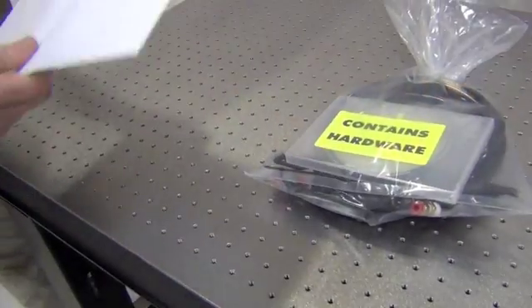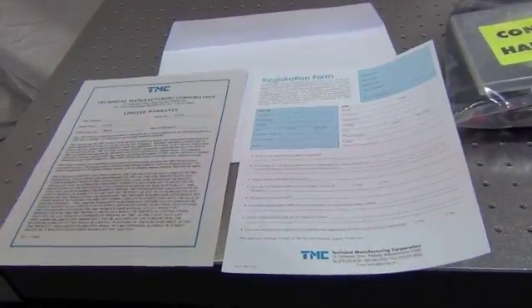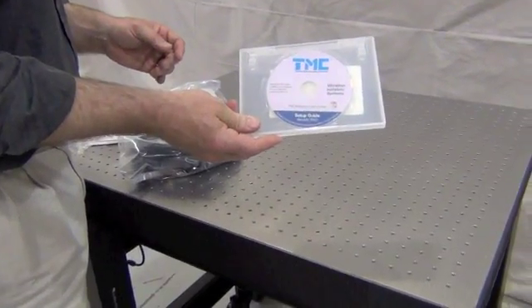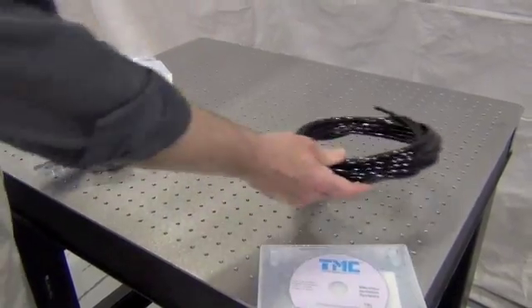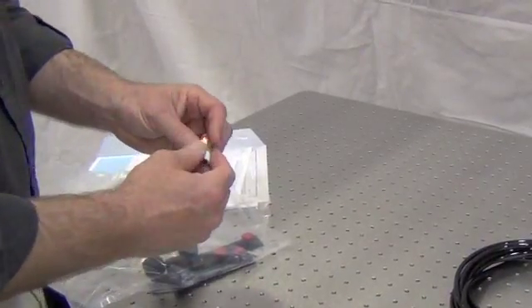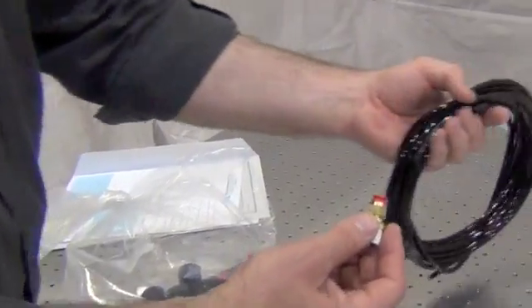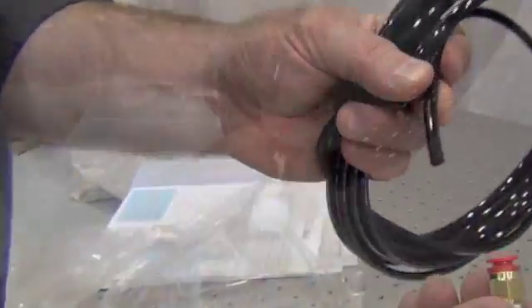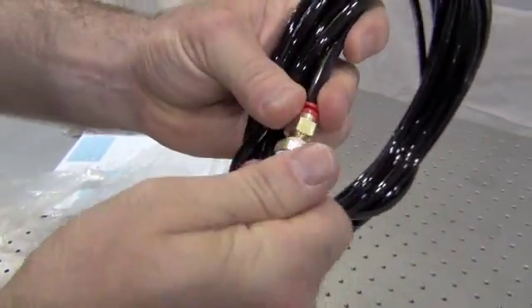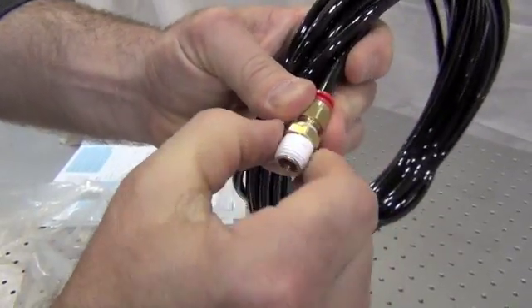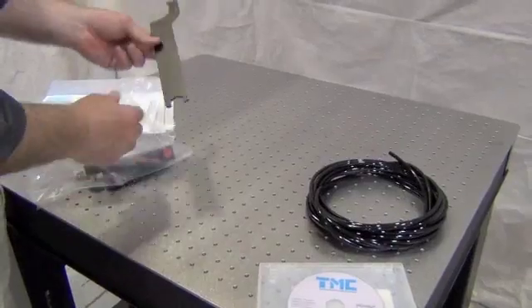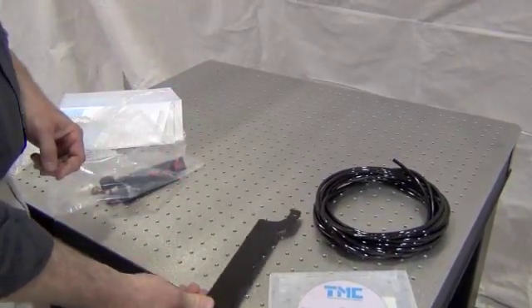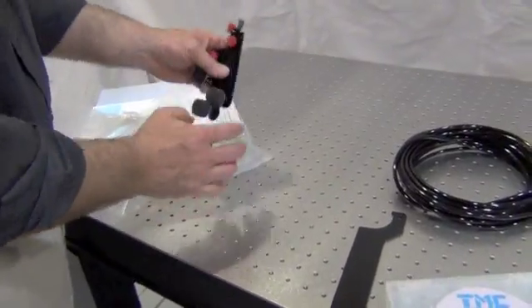Note, in the hardware bag you'll find the warranty card, product registration forms, a CD containing the setup guide, 20 feet of quarter inch tubing, and a press lock fitting for the end of the tubing, as well as a reducing bushing which allows for the option of using either one-eighth or one-quarter inch NPT male threads. You'll also find a black wrench which is used for adjusting leveling feet and three valve control arms.